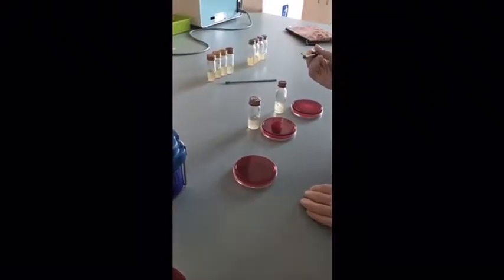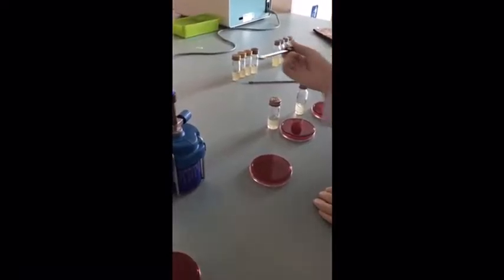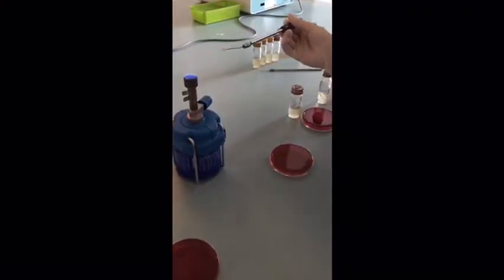After we have done for the sample from the FPSK pond, next we will proceed with the water sample from the water cooler. And for the first streak plate, we will also be doing for the double strength lactose fermentation broth. That is, we use the 10 ml of the sample into the broth given.